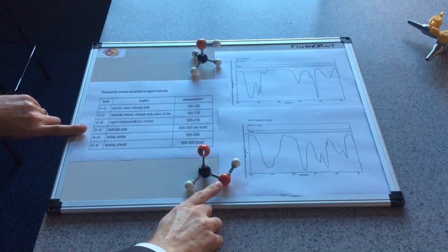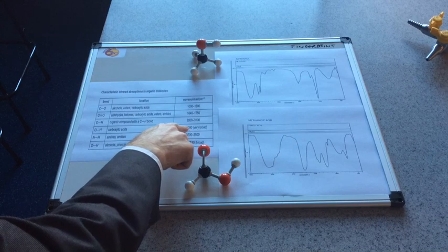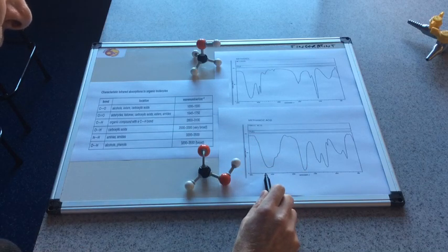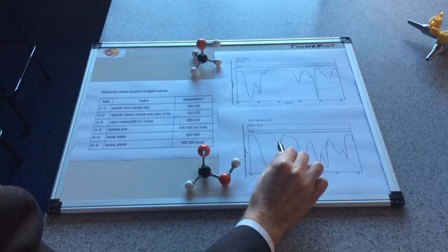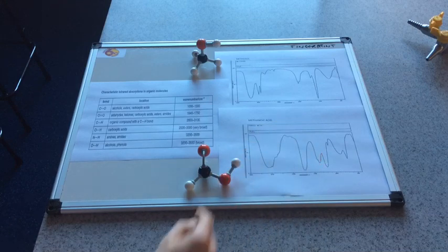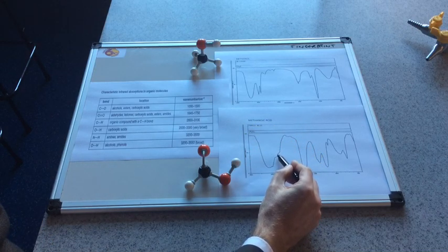The OH of a carboxylic acid gives a very broad absorption - very, very broad - and it's between 3300 and 2500. So you can see this is starting at about 3300 there and 2500 is obviously over there, so this fits in with that region. The CH absorptions will be lost within this broad absorption here - they are there, but they've just become part of this very broad absorption; those little extra spikes are probably the CH bonds.